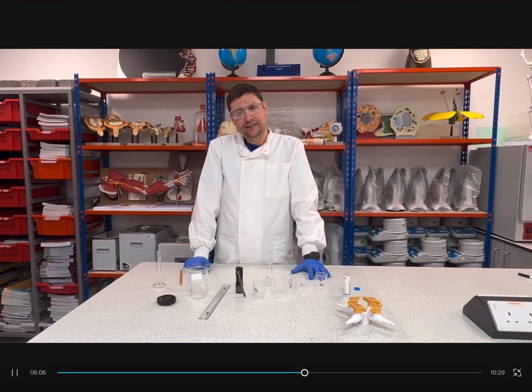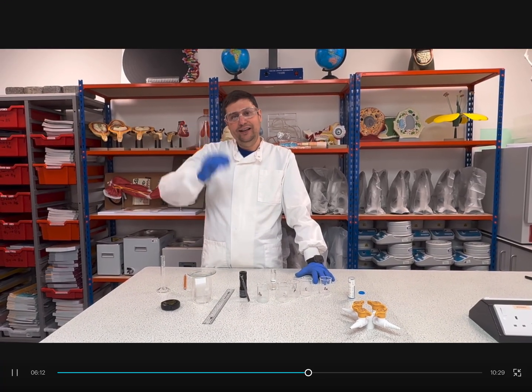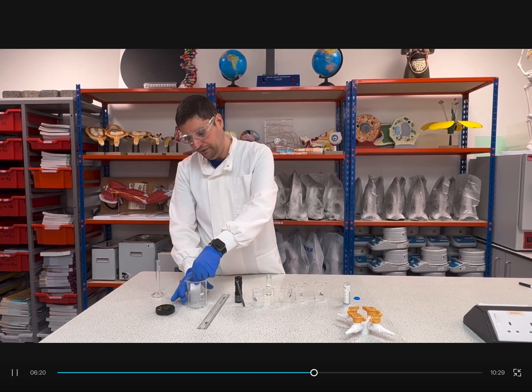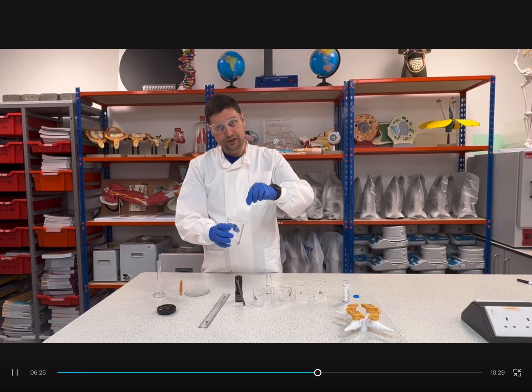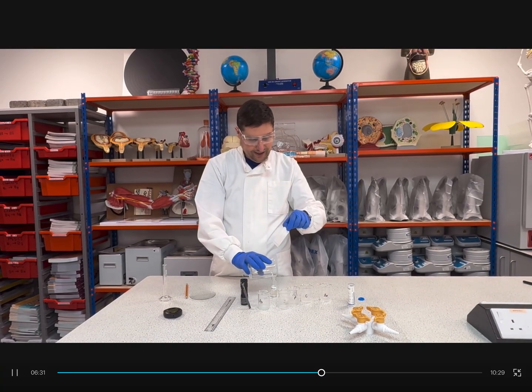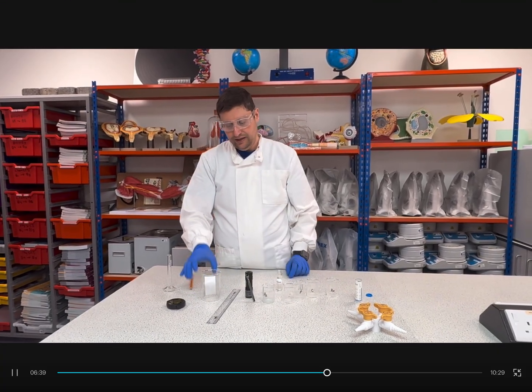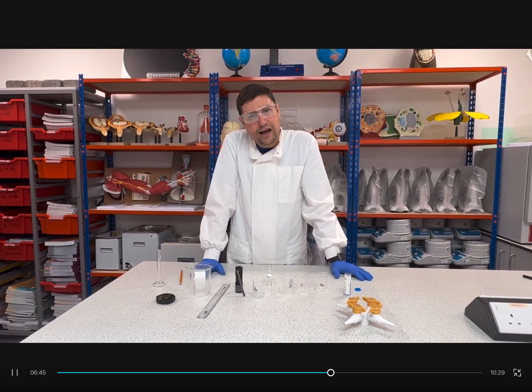So after a couple of minutes, when we reach about 75% of the height in the TLC plate, we will open the lid, take the plate off, and transfer the rest of the solvent back to the sample bottle, so we can reuse it again. Now we place the TLC plate back and we will keep it for a couple of minutes to dry out.